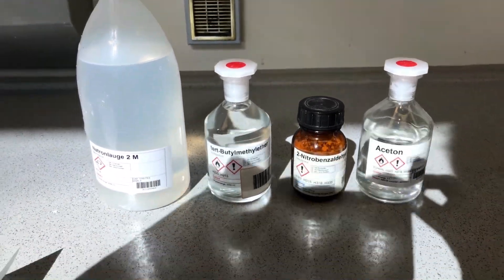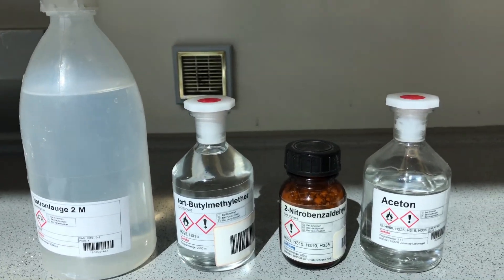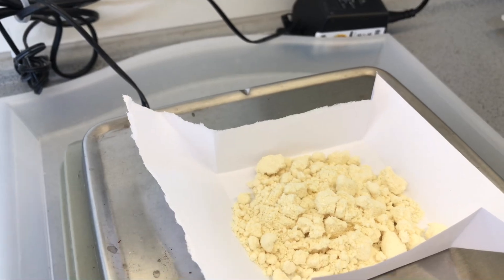For the preparation, 9 grams of 2-nitrobenzaldehyde, 90 milliliters of acetone, 18 milliliters of 2-molar sodium hydroxide solution, distilled water, ethanol and 45 milliliters of butylmethyl ether are needed.